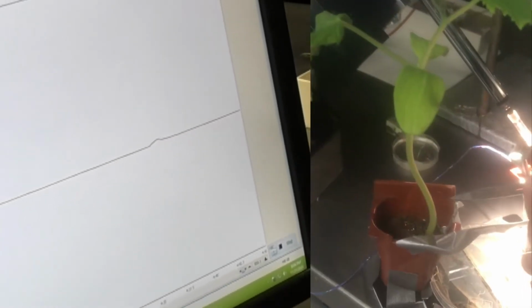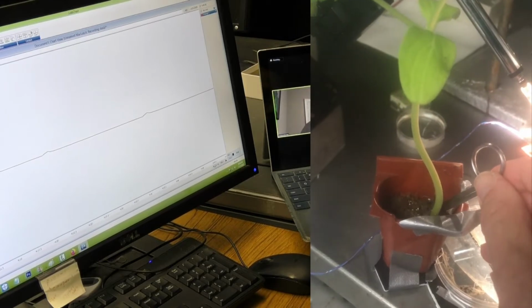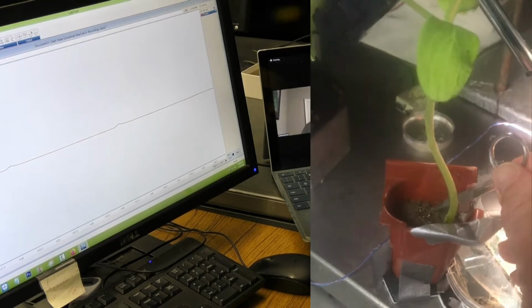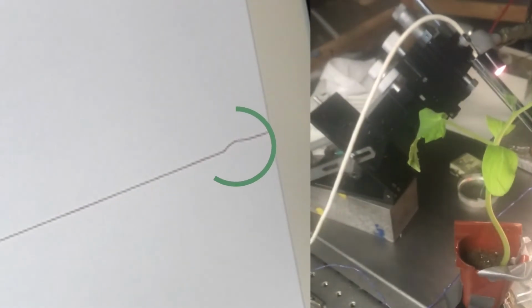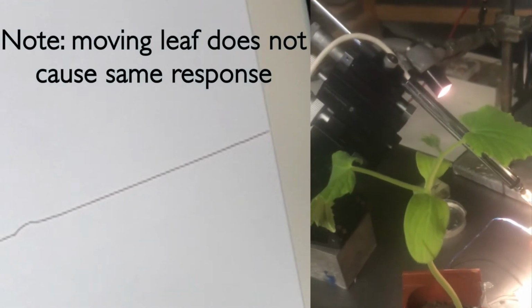What'd you say? I wonder about movement. If you move the leaf, it's not a fast depolarization. It's more like the artifact. Maybe I cut a little nip up here because I don't move the thing. Well, it gave another little bump. Maybe just try nudging it with the scissors just to see if it gives the same type of artifact. Yes, I'm going to touch the same leaf I just cut there. No, it doesn't give the same.